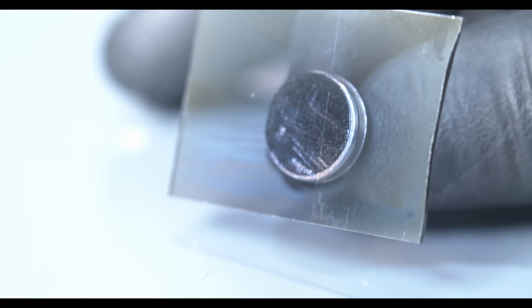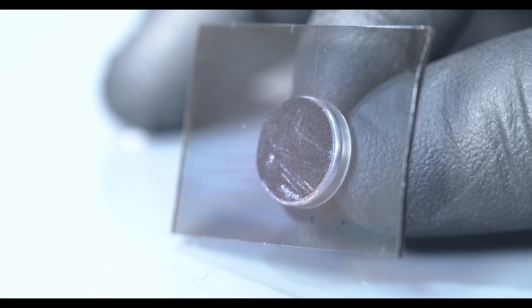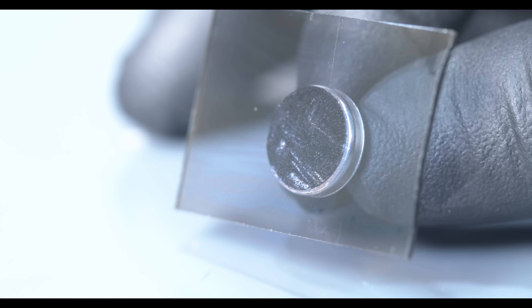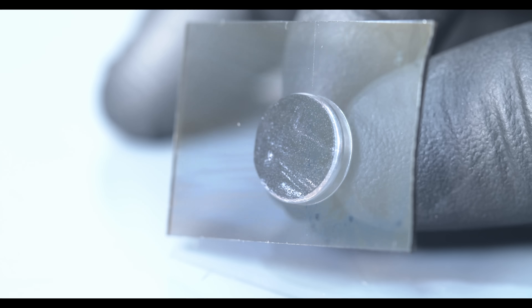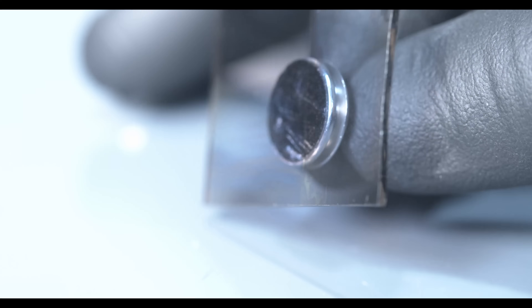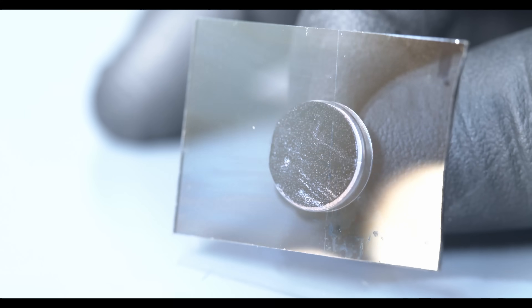We're going to put this into the SEM now, but glass is an insulator, so it won't behave nicely under the electron beam. So I've sputtered a thin layer of silver on top of it — just five nanometers — which won't be enough to really affect things, but gives it a little bit of a shine to a kind of dull gray color. It will be conductive enough that charging won't be as much of an issue.